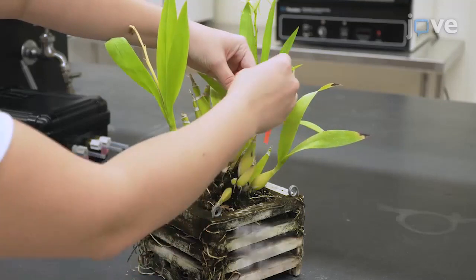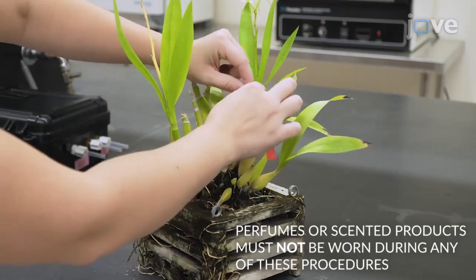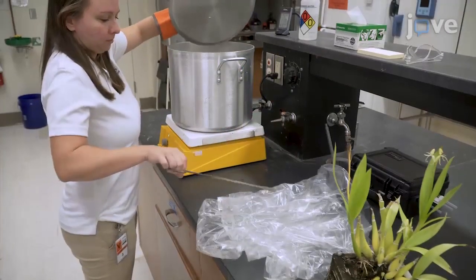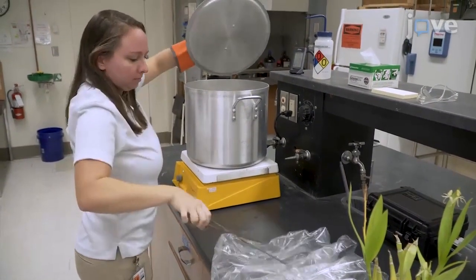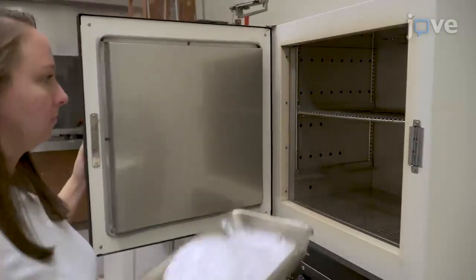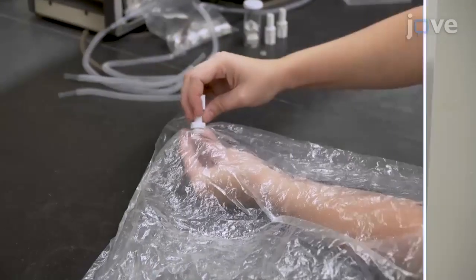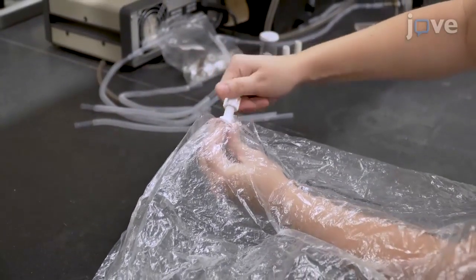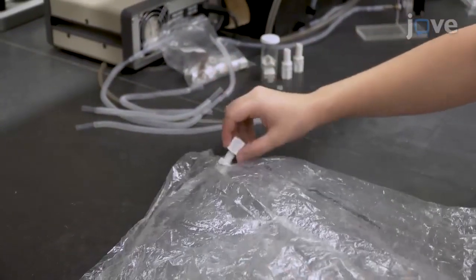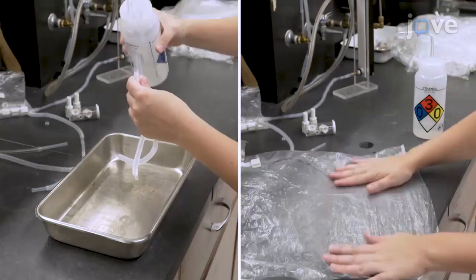To begin, select a flower that is initially unopened and mark the flower with flagging tape to ensure repeated sampling of the same flower. Boil oven bags in water for 30 minutes to remove residual plastic compounds. To dry, bake in an oven at 175 degrees Celsius for 60 minutes. Once the bags have dried, add a polypropylene bulkhead union to each corner of the closed end of the oven bags.